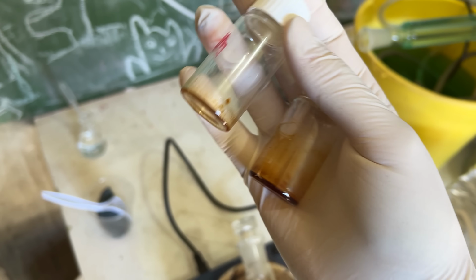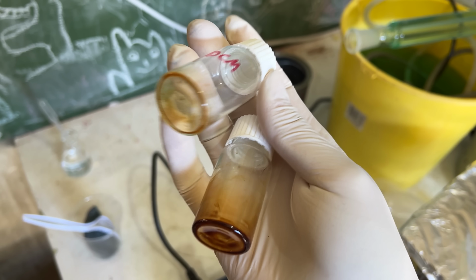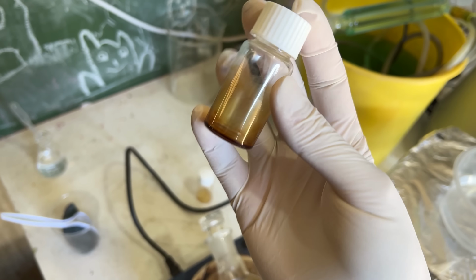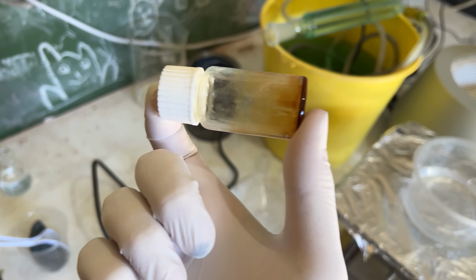So these were the DCM extracts. I'm assuming it's the same product, but there's very little in here. So this could just be impurity. So maybe we'll just forget about this one and just look at the ethyl acetate extracts, which is this one. It was a yellow solution that went down into a red tar.